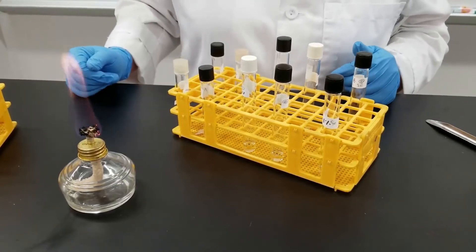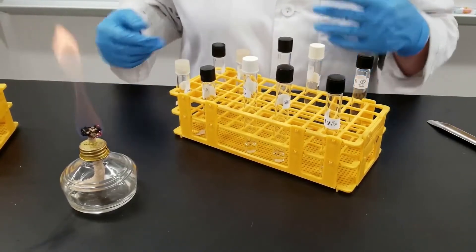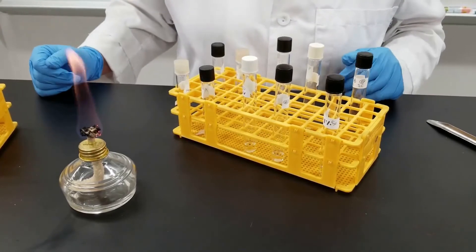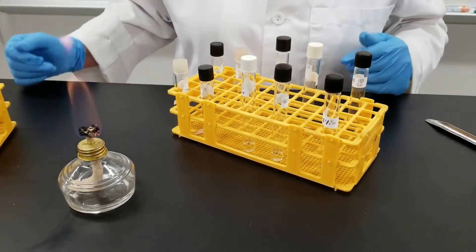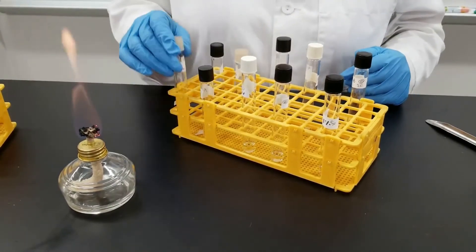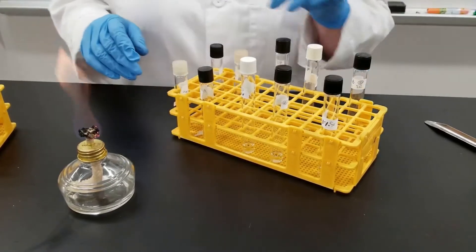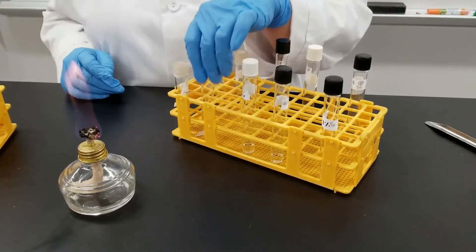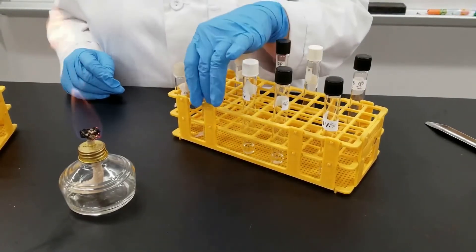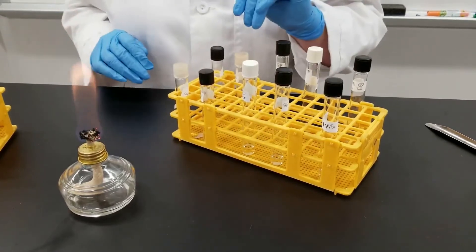Garlic has also often been touted as having inhibitory effects on bacteria, so we're going to add some garlic to a nutrient broth as well. And then we're going to have our control, which is just regular nutrient broth — no salt, no garlic added.